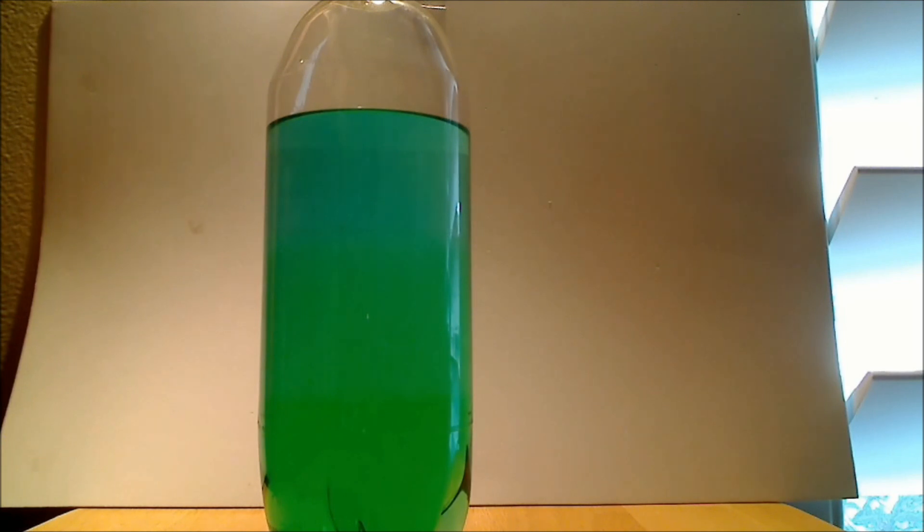And actually a green dye is a good choice to use because it's really a mixture of blue and yellow. Blue and yellow make green. And it so happens that the blue dye seems to have more of a preference for the non-polar, less polar isopropyl alcohol phase.